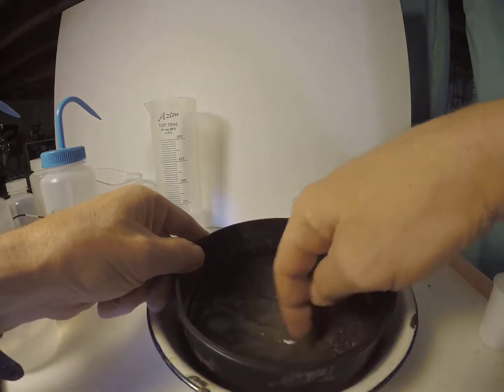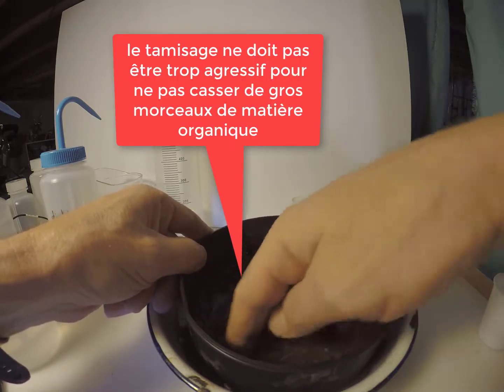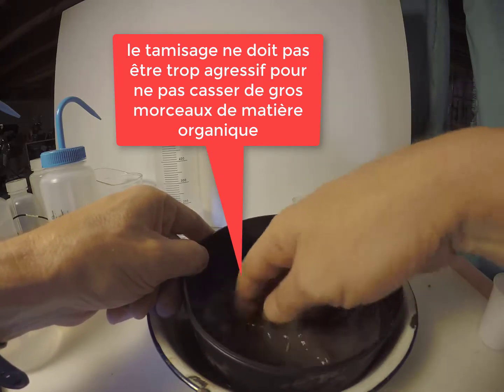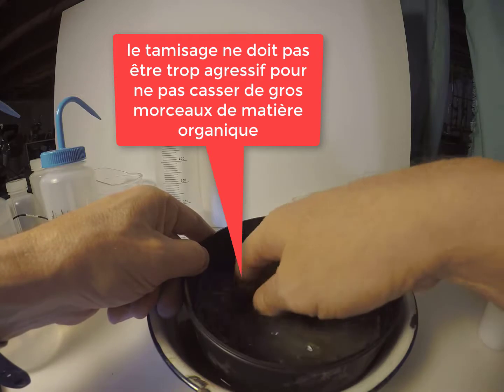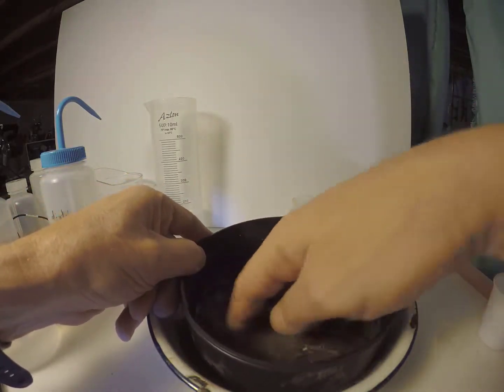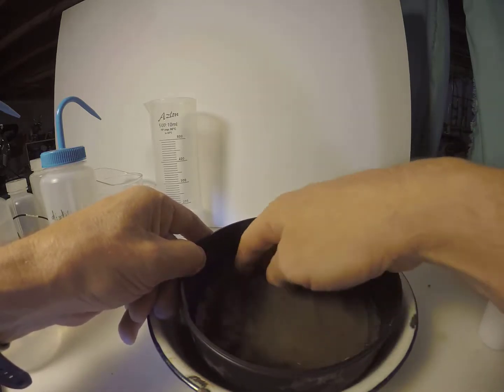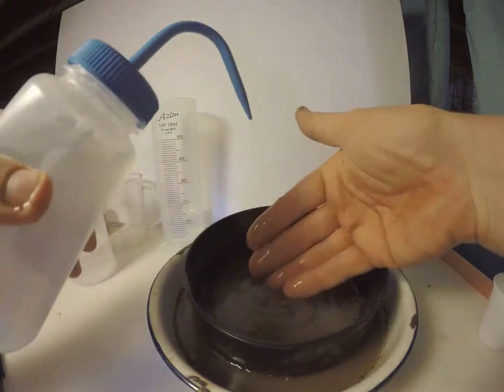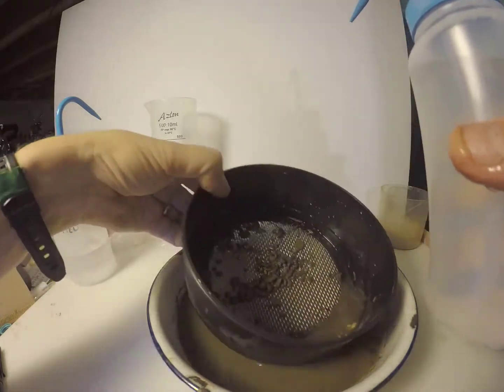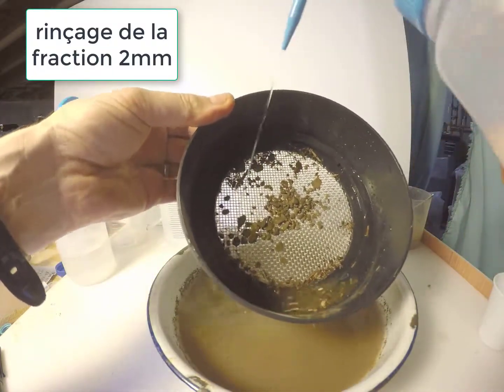Then this fraction is gently wet sieved on the 2 mm sieve using fingers. This should not be too aggressive so that organic matter particles are not broken up and forced through the sieve. We only want to break up and rinse through the soil from larger aggregates. Once the finer material has been sieved through, the 2 mm fraction is rinsed with a little additional water.